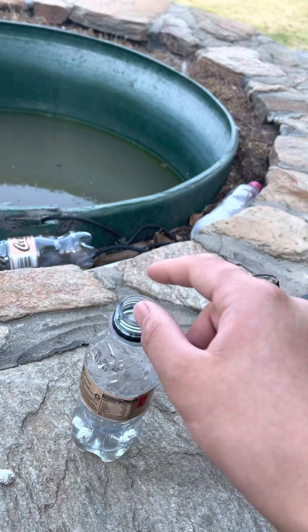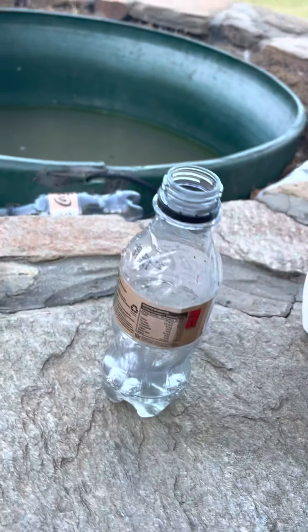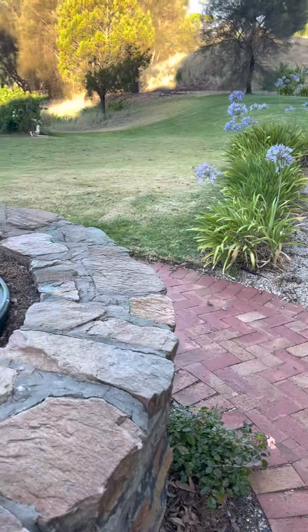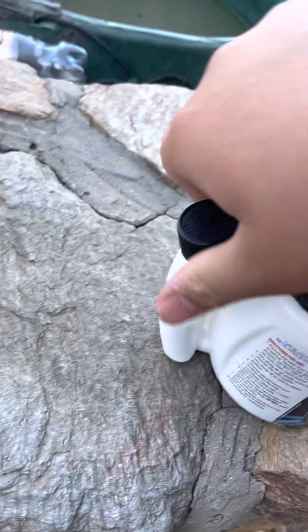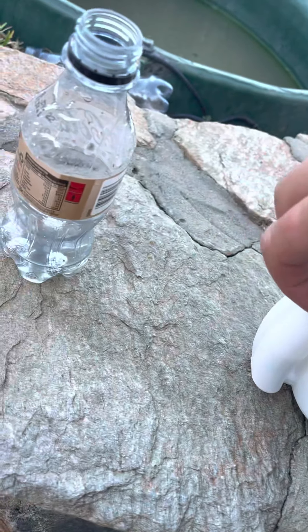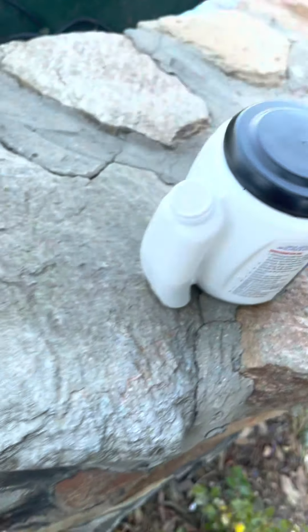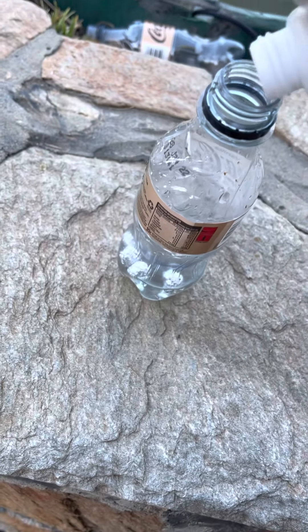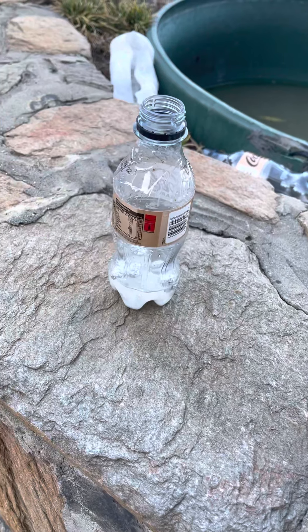This is just to show what will happen. Aluminium goes in like that. And now with the sodium hydroxide, I'll tip some inside of here. Don't want too much — I probably won't even add all this in. Give it a little twist — child proof safety cap, as always. Put the caps on, guys, don't want kids getting into this because it will burn them, obviously. Then dump quite a bit of it in. That's about all I will put in, and watch the reaction, give it a little while.